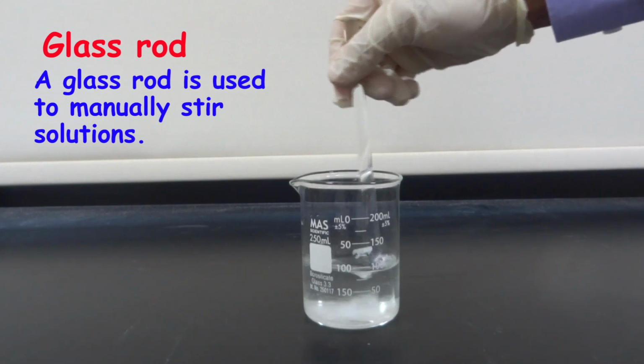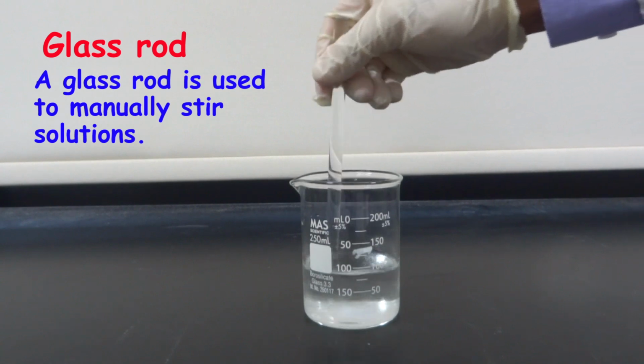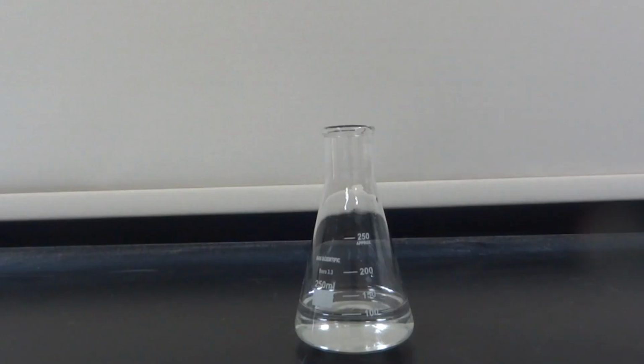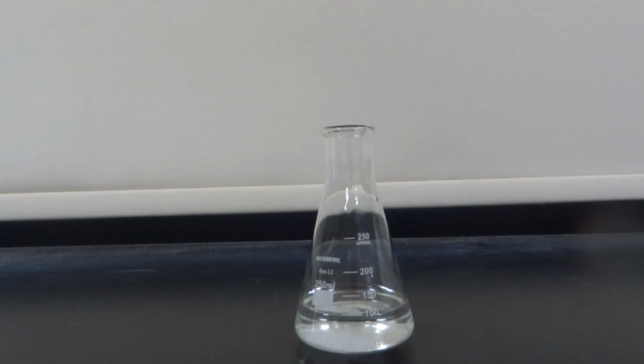A glass rod. A glass rod is used to manually stir solutions. Conical flask. A conical flask is a container with a narrow neck, which allows mixing by swirling without splashing out.